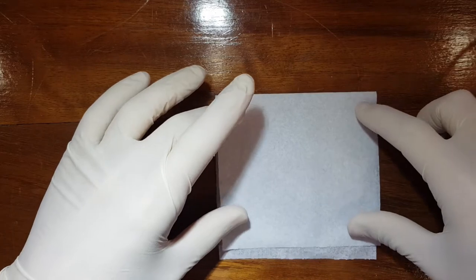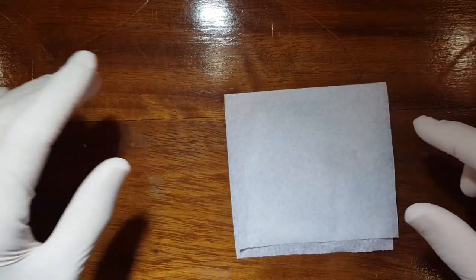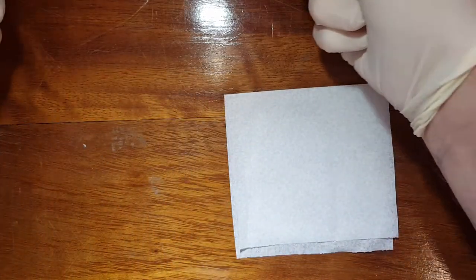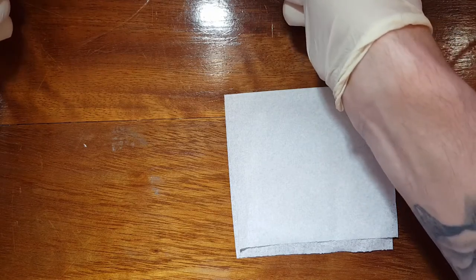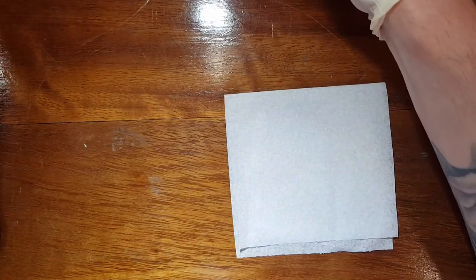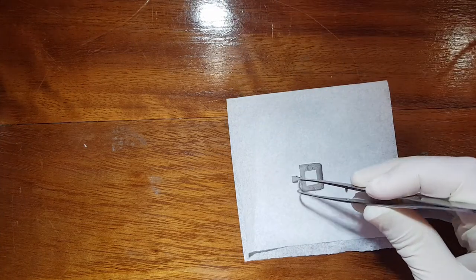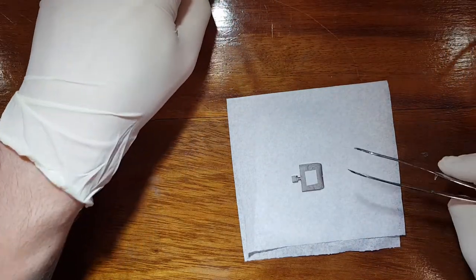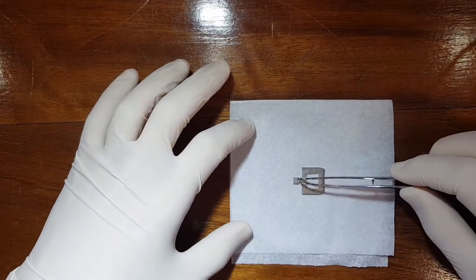Now we're all gloved up. I'm going to take a little kim wipe as in the previous video to be a little place where we place our sample holder. Now we can remove a sample holder using a tweezer, which is one I have prepared for us in the previous video.